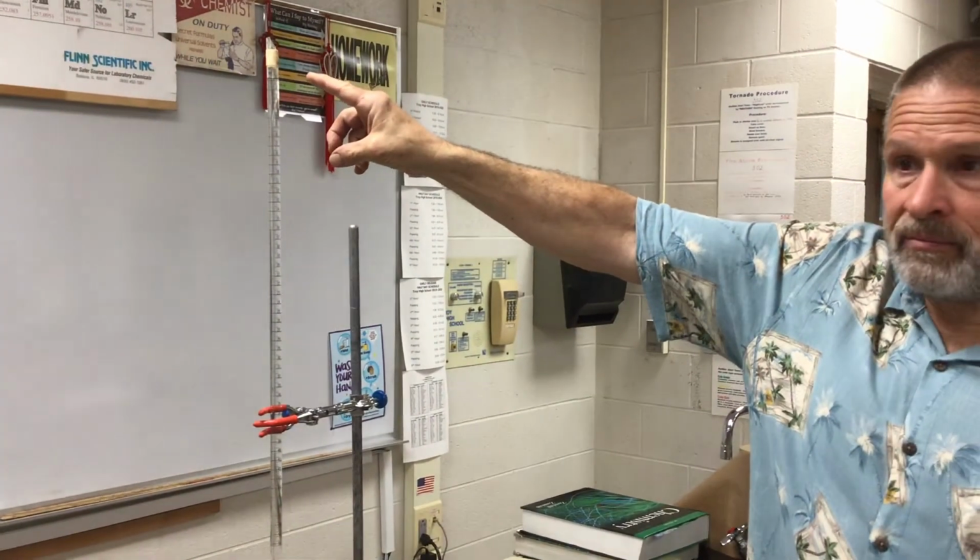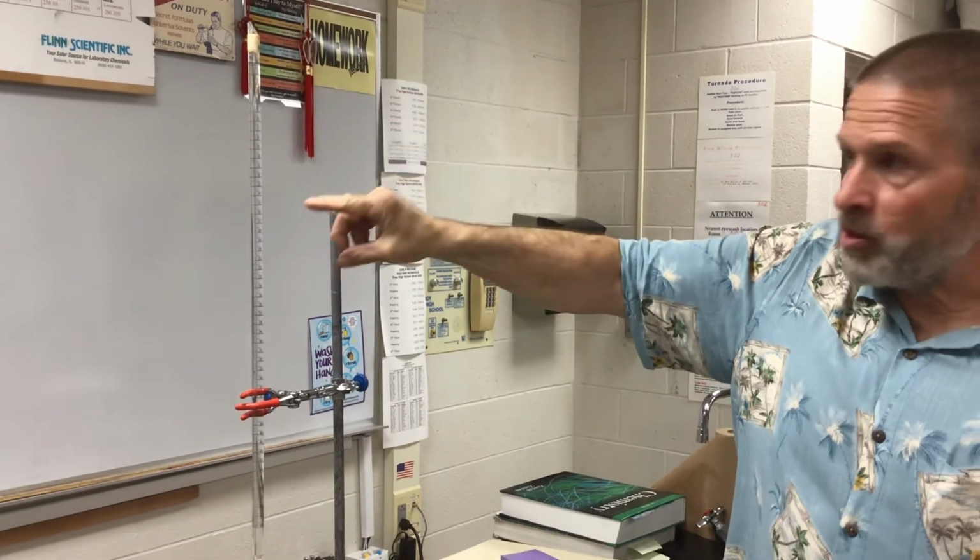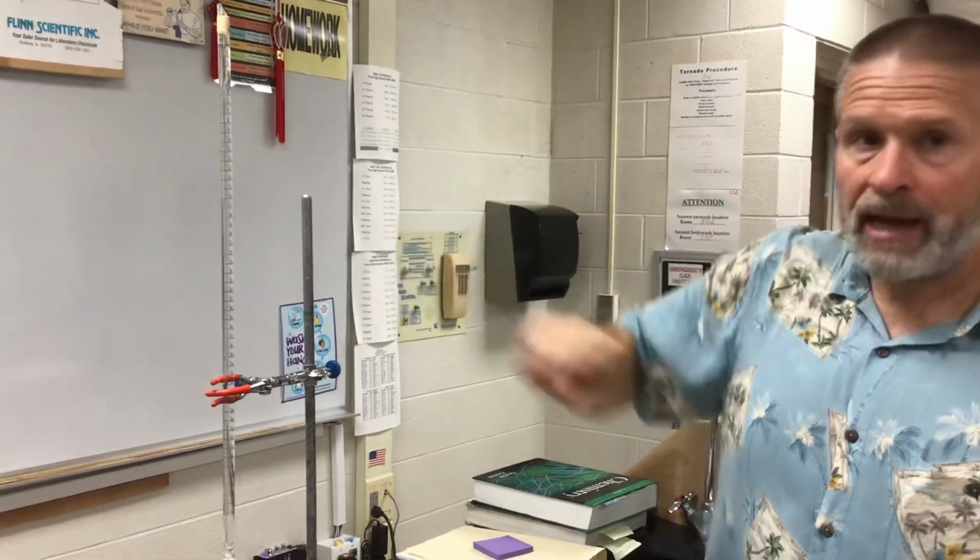Oh, I remember doing that for integrated rate law. We have to make 3 graphs. And we'll need to see which one's the most linear, and that'll tell us the order. That's the heart of what's going on. So we're going to try to find the order of the rate of draining the Buret. Yes. And remember, once again, it's total time from the start. Time to 5 milliliters, total time to 10 milliliters, total time to 15.